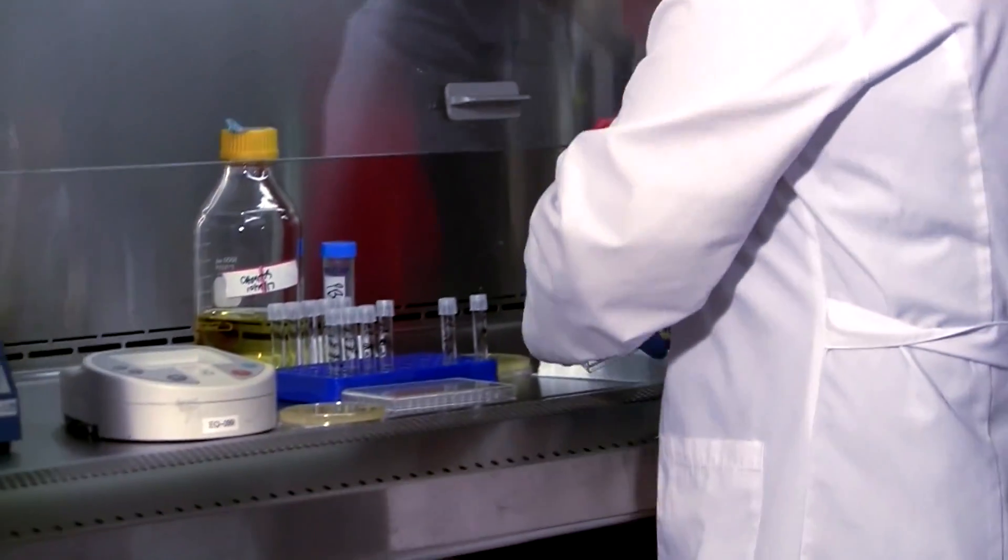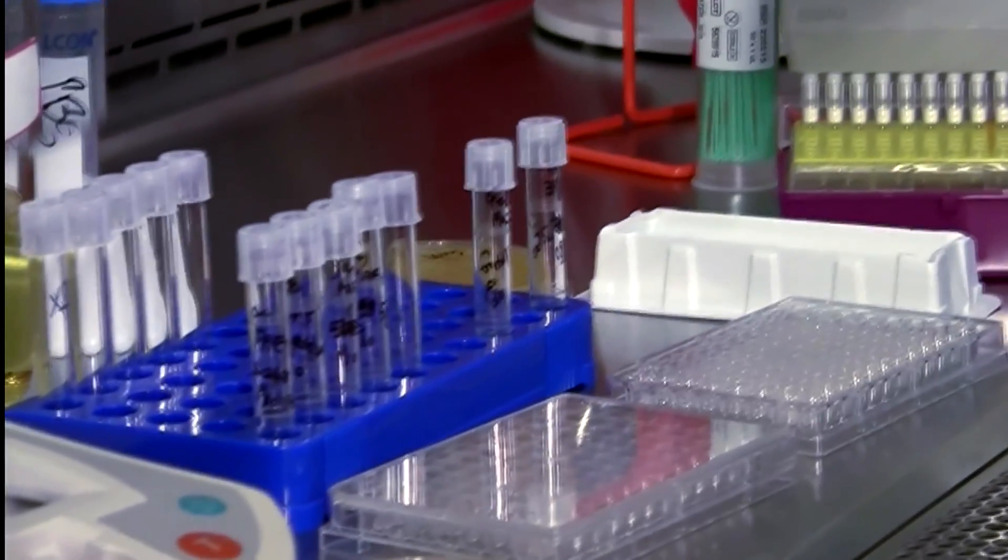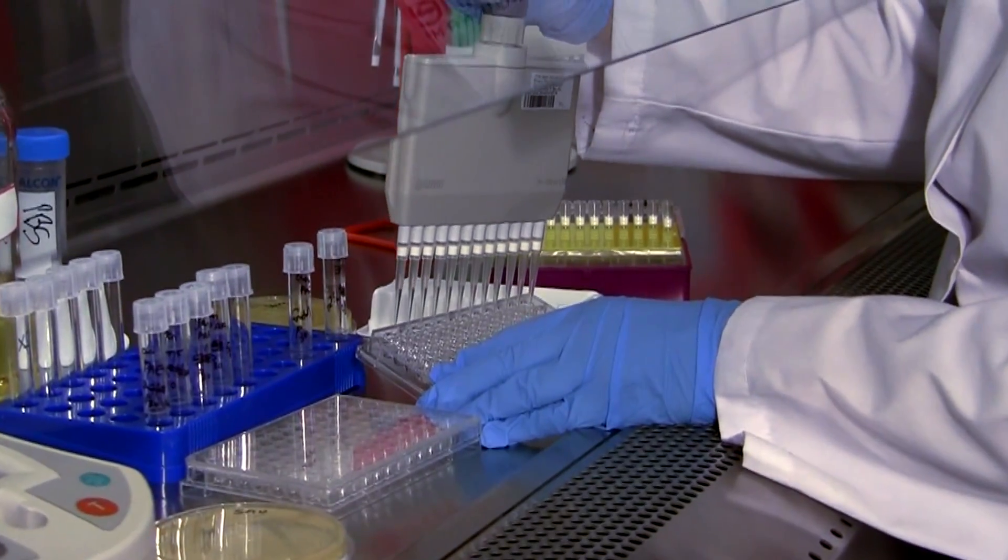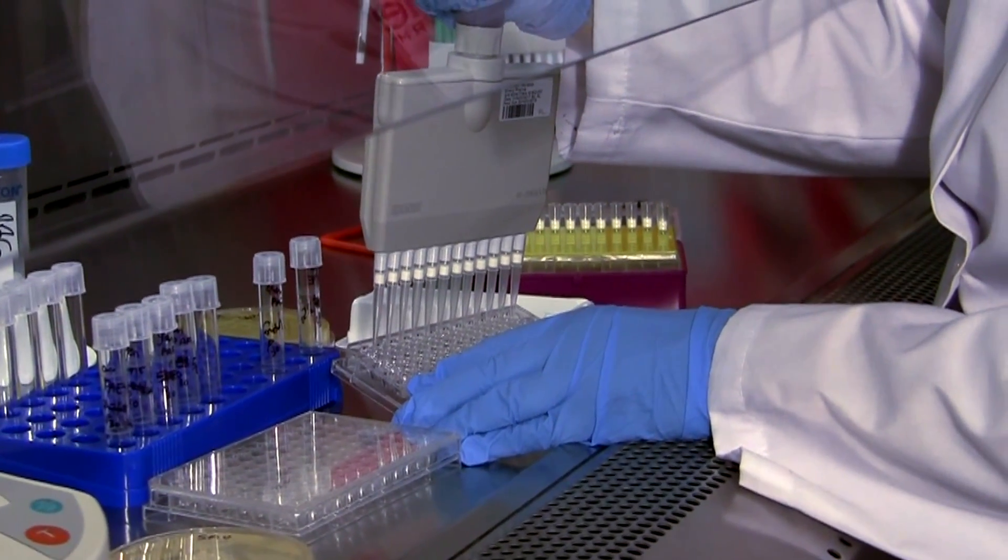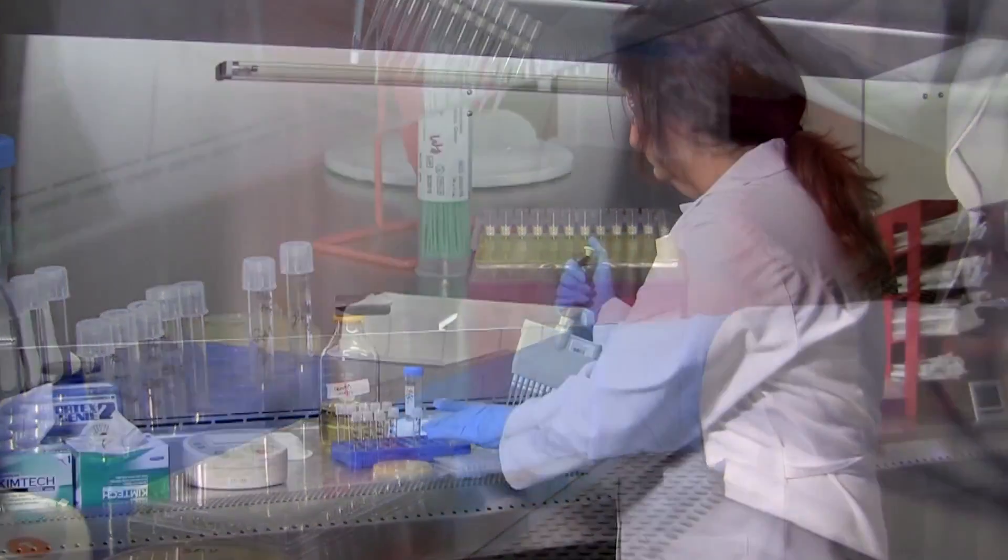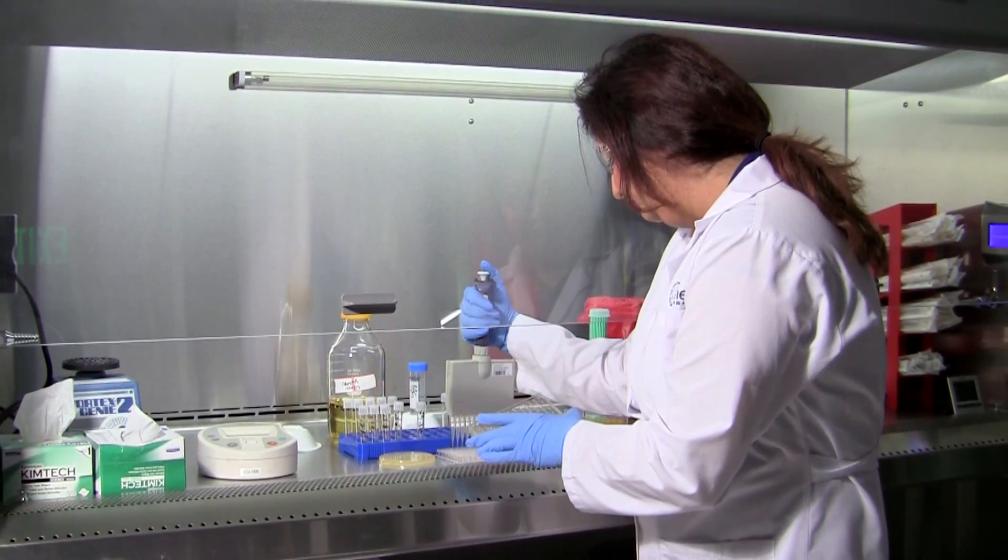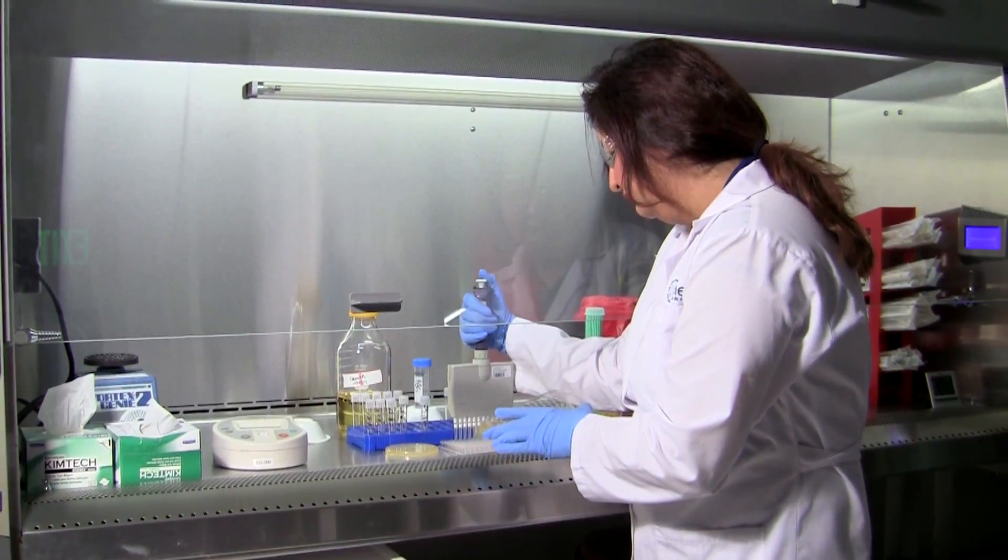The macro dilution uses a larger volume where we use these tubes, whereas the micro dilution is done in a 96-well plate format. So for today's demonstration, I will be using a 96-well plate format.